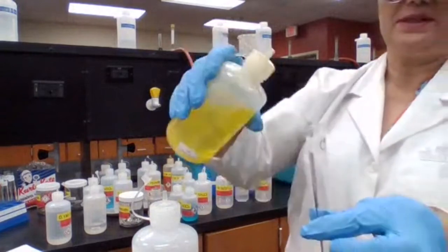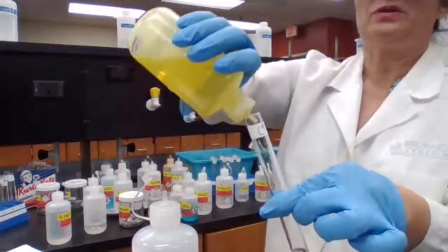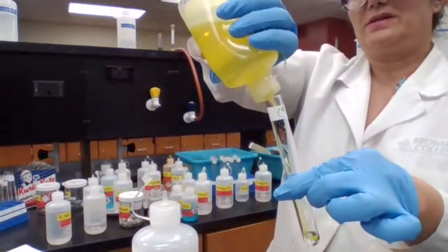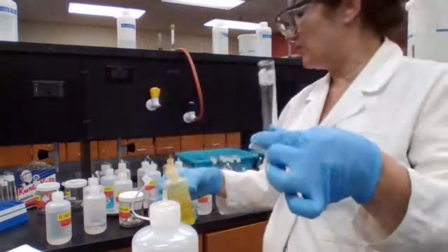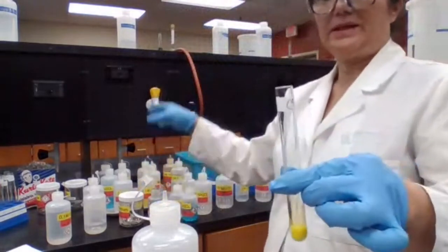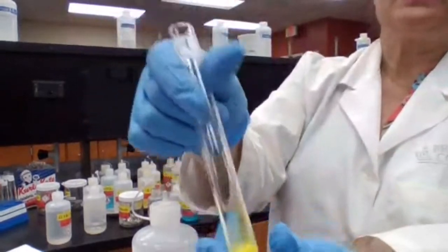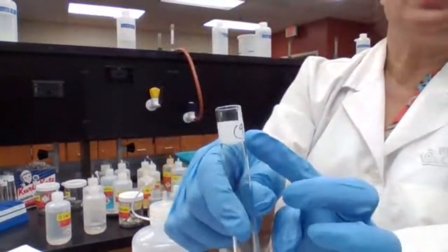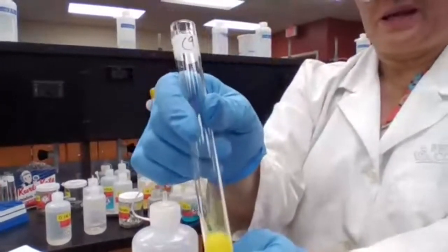There is no precipitate in there. There is no solid. Both of them are aqueous solutions. One just happened to be yellow color, but it's clear. When you mix it, you get this yellow color precipitate. So for test tube 9, evidence is the yellow color precipitate that it forms.